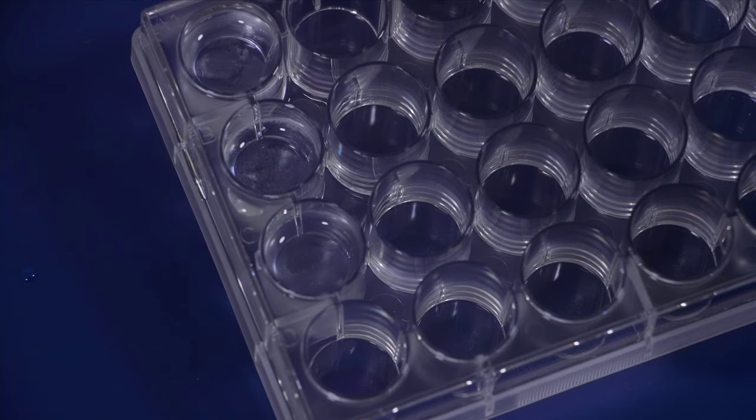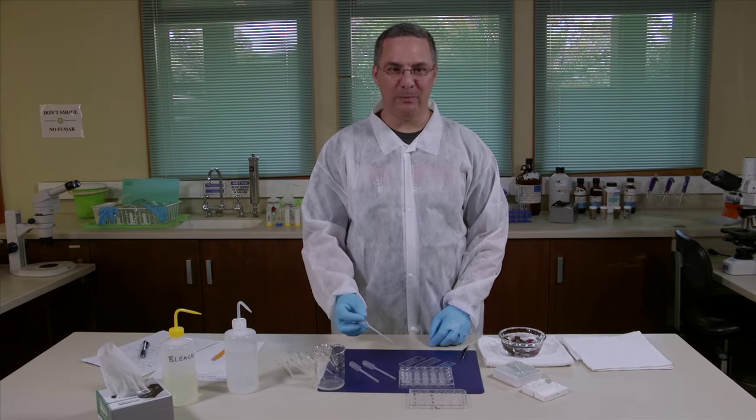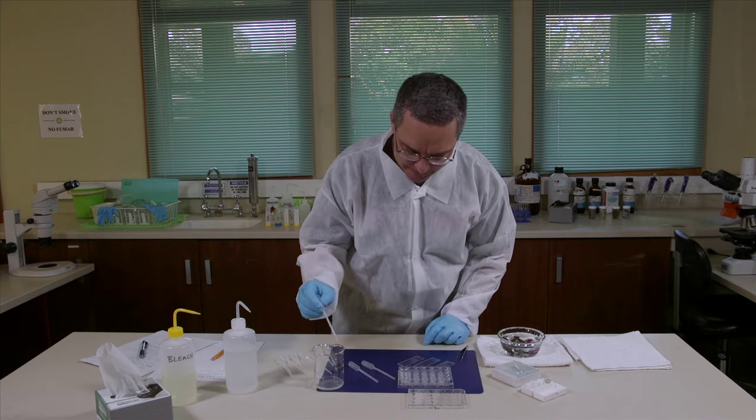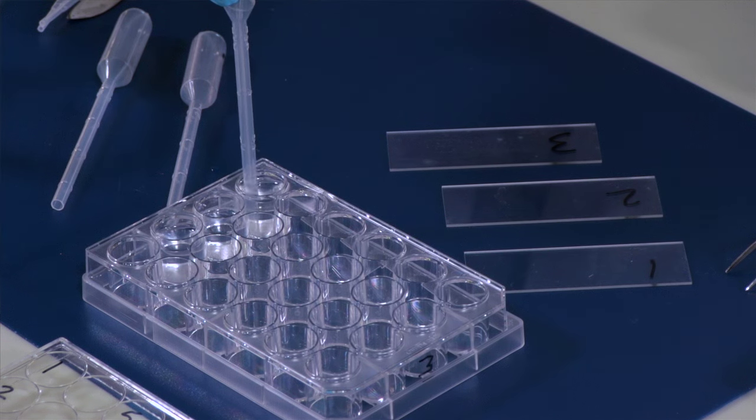Now that we've rinsed the bleach off of these spicules we can put them onto a microscope slide. I'm going to use some labeled pipettes to do that. We've got one for each specimen so that we don't contaminate the spicules of one species with those from another.